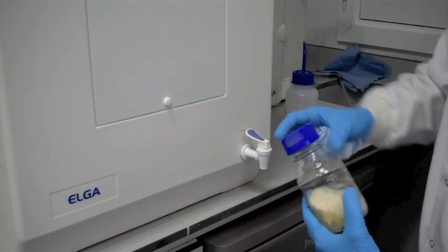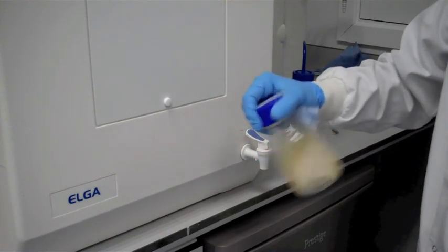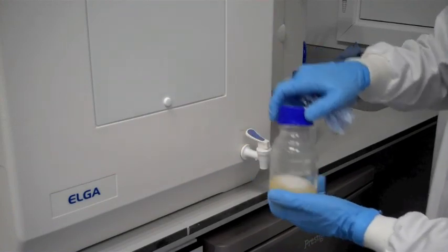Then place the top back on firmly and give it a little agitation, which will mix the media in. Okay, you can see the media's now mixed in.